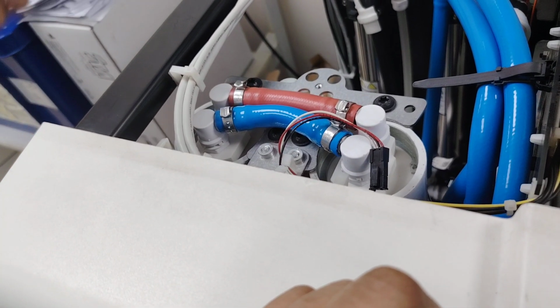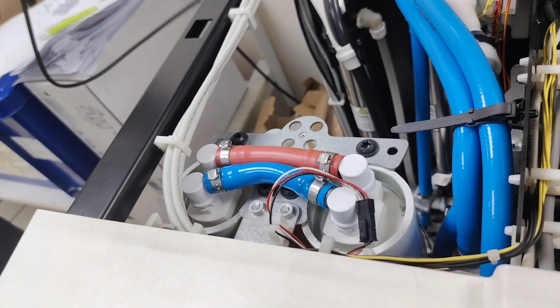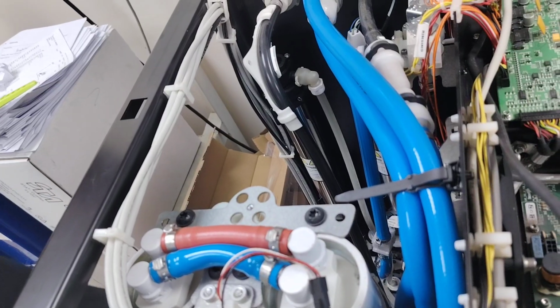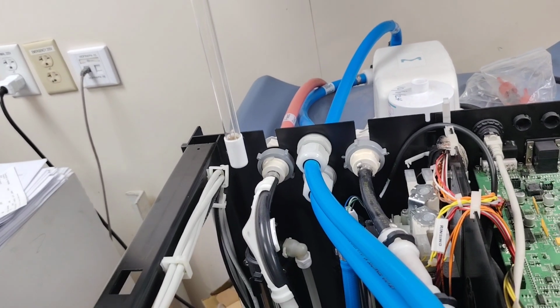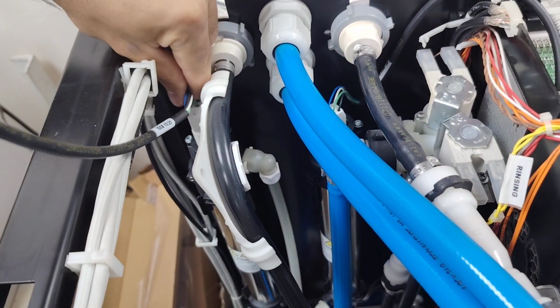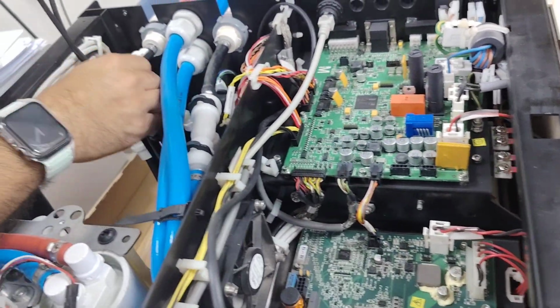Yes, because last time when I called Engineer Abbas, he told me to make a request for this lamp. So when it comes, I see, yeah, this is clean, and still, of course, this is not in use. Alrighty.